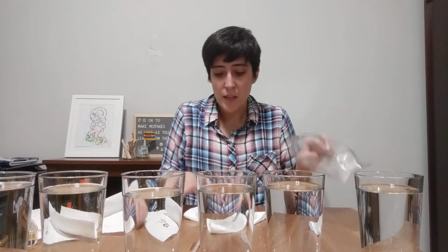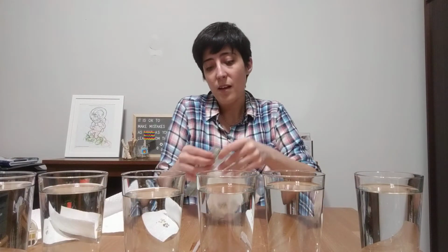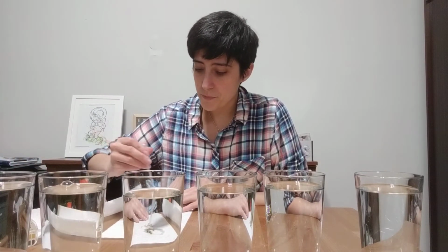And of course, this is not ideal. So this could be something you could talk about in designing an experiment. But, you know, I don't have a lot of syringes laying around my house. And the best way to get these wet so that I don't just pour water all over my floor is to use the one syringe that I do have. All right, second to last one.